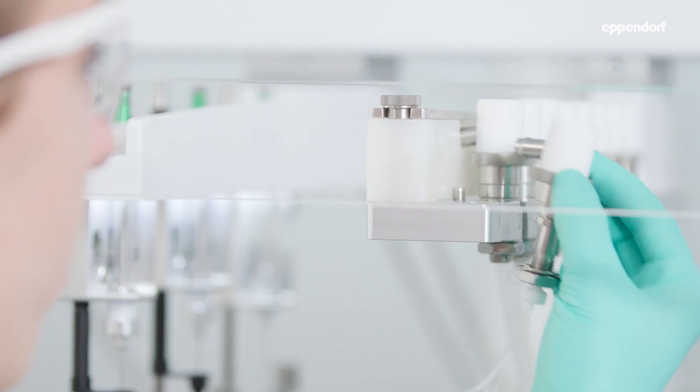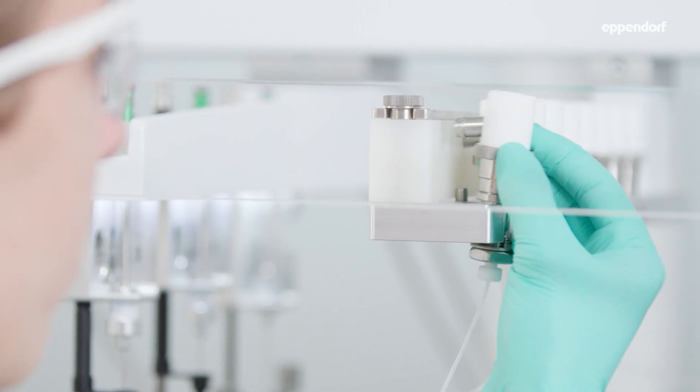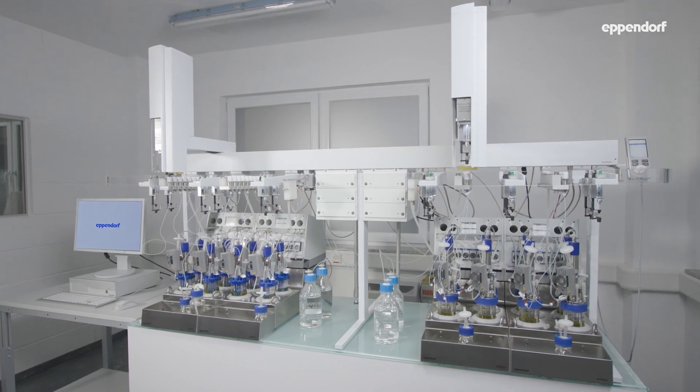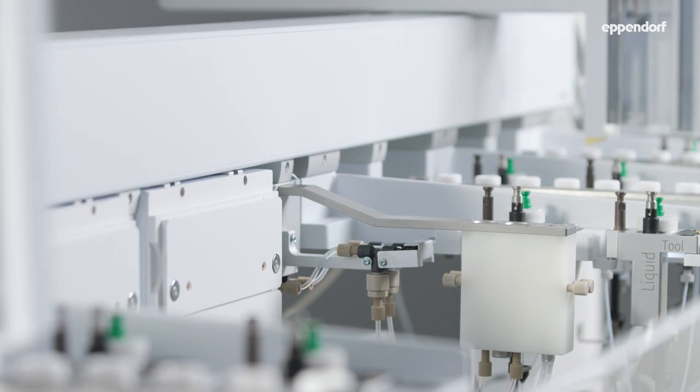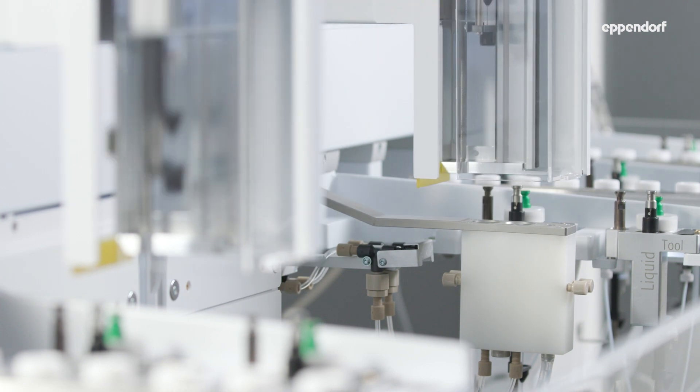It really helps you to make your work in the lab more efficient. The AutoSampler solution is an integral part of our digitalization strategy for bioprocess.